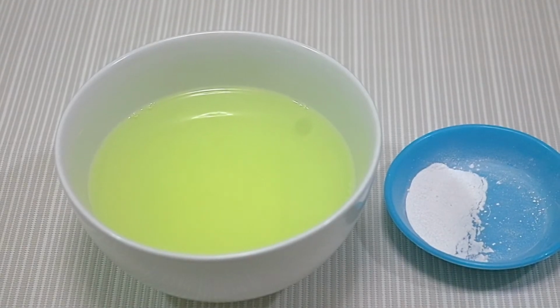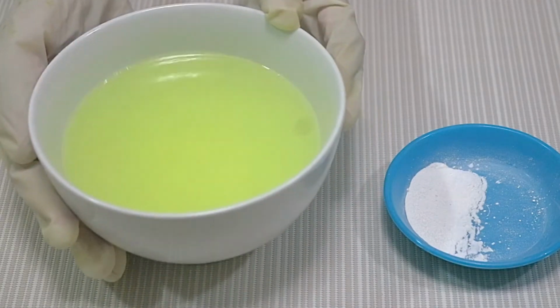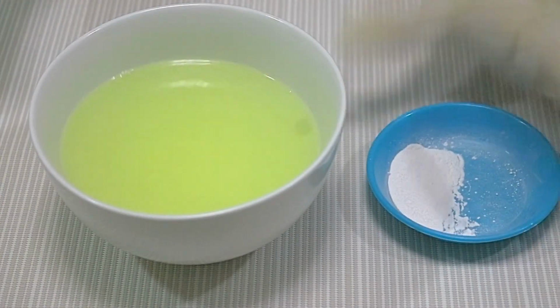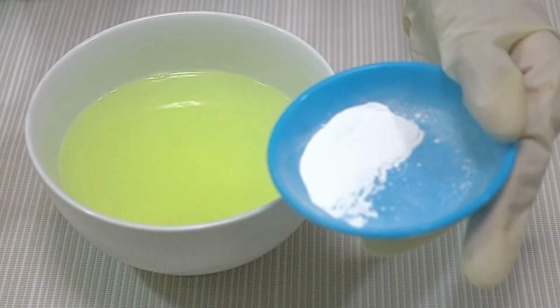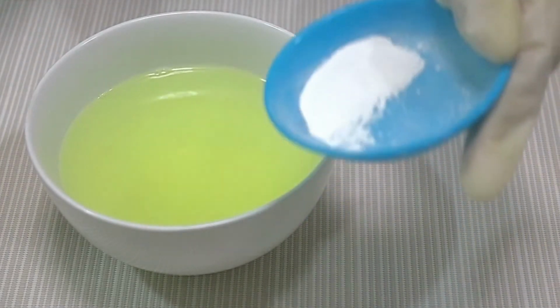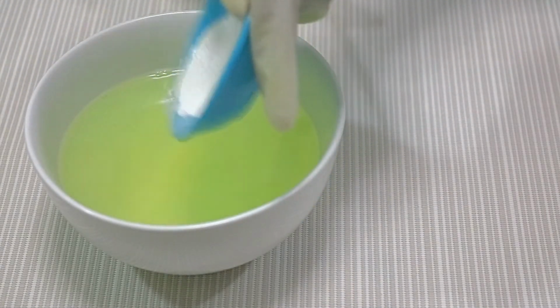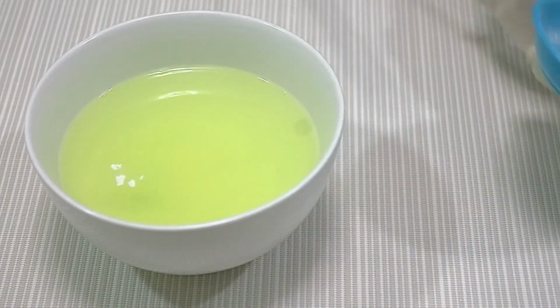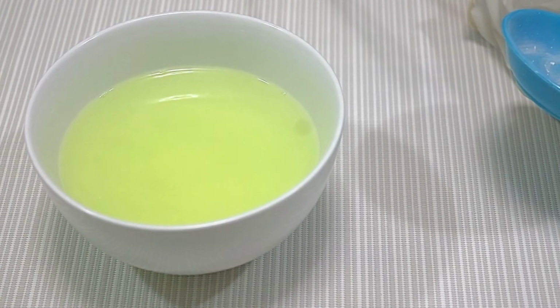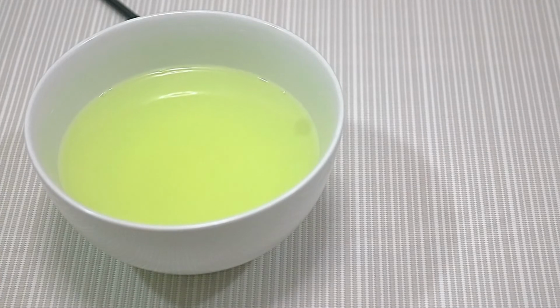This is another experiment using water that is already mixed with the dish soap, with some talc powder. Now, I'm going to pour the talc powder over the water that is already mixed with the dish soap, like this. As you can see, the talc powder is also drowning like the paper clip. It is because the soap contains the surfactant which can reduce the surface tension.